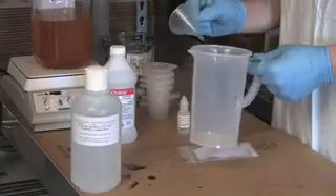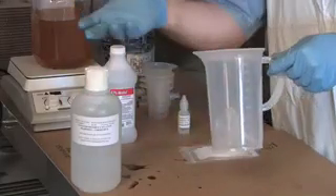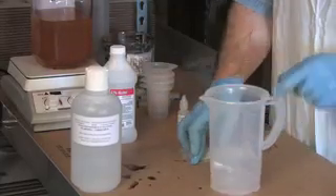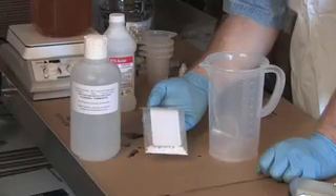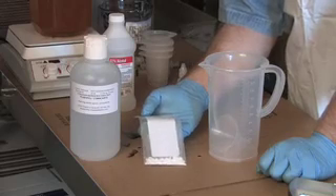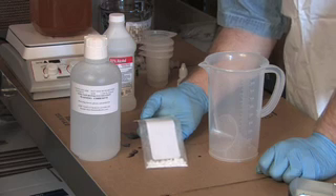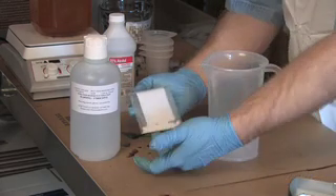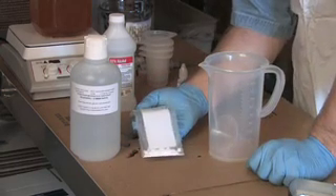The next thing we're going to do is do an actual titration. You can put this away and save it for when you need to remake your titration solution, as you'll only need to do this once. This is probably where you need to be most cautious because you are dealing with chemicals. Make sure your chemicals always stay dry — if they don't, they'll ruin themselves, much like hydrogen peroxide if you leave the lid off. Oxygen from the air will react with it and neutralize it. If your chemicals are clumpy in any way, shape, or form, you may need to get new potassium hydroxide or sodium hydroxide. That's one very important point to note.